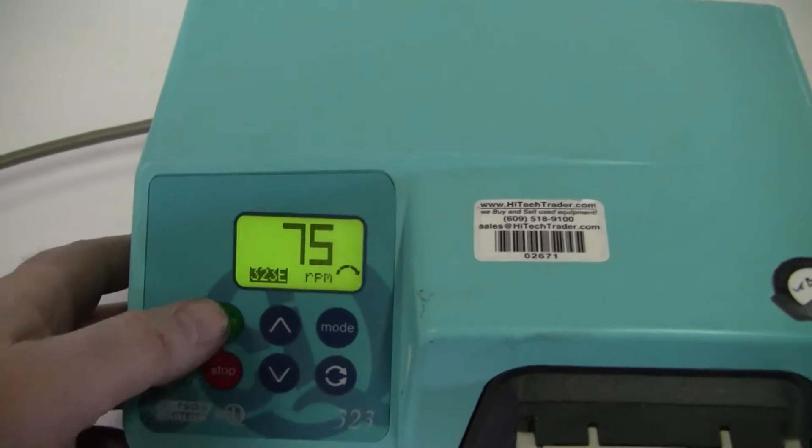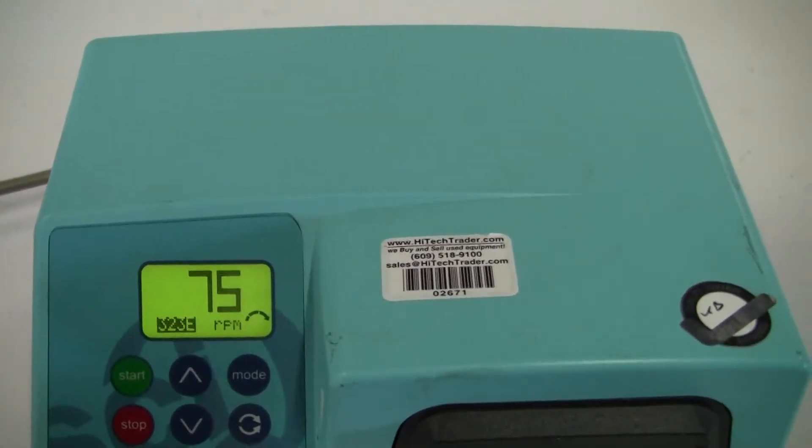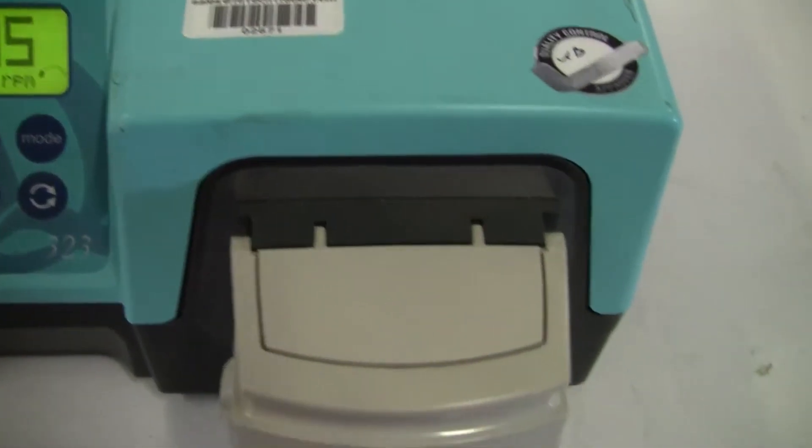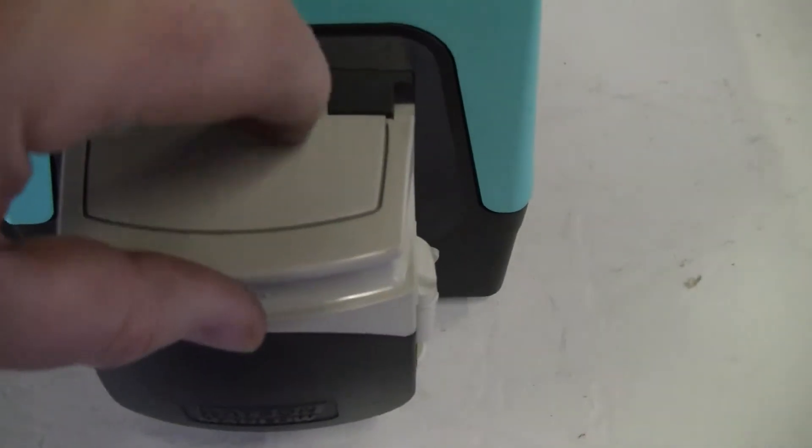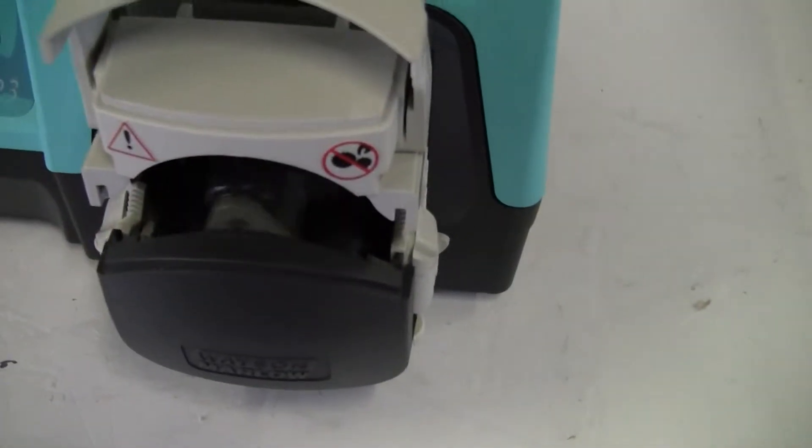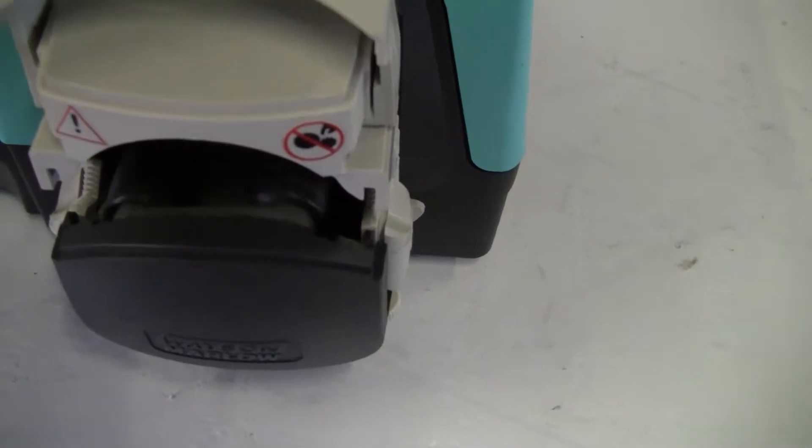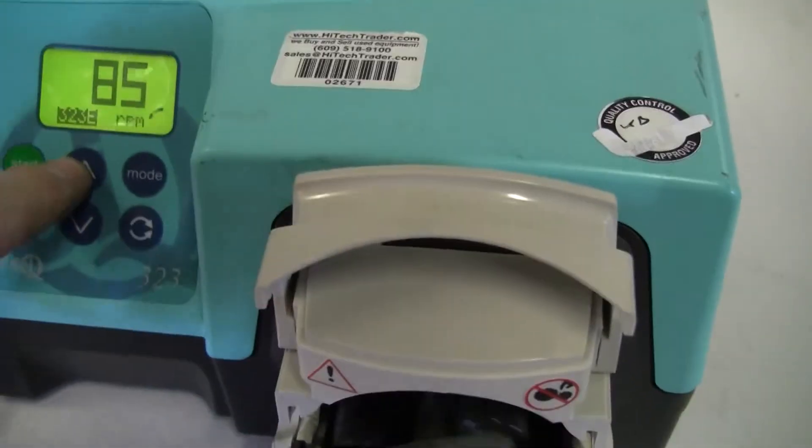Let's take a look. See the pump head turning. Increase the RPMs a little bit.